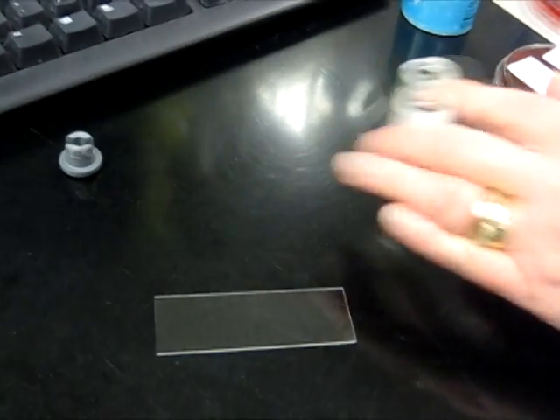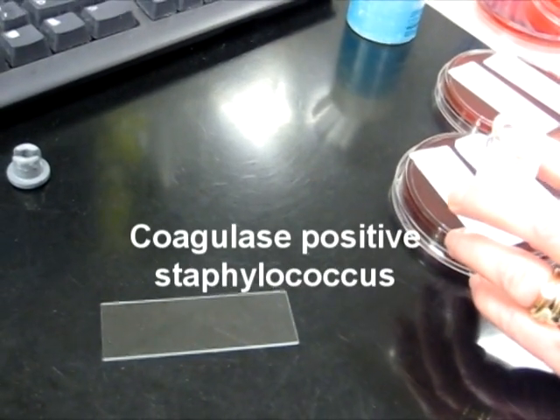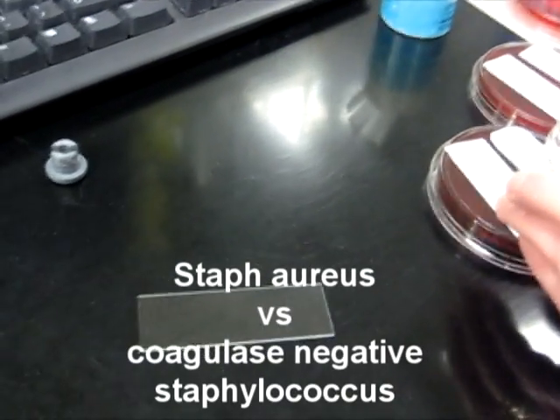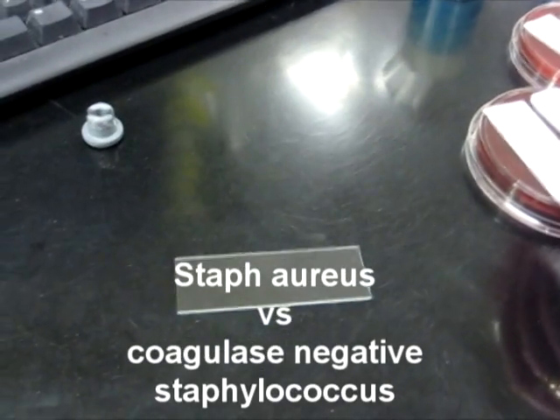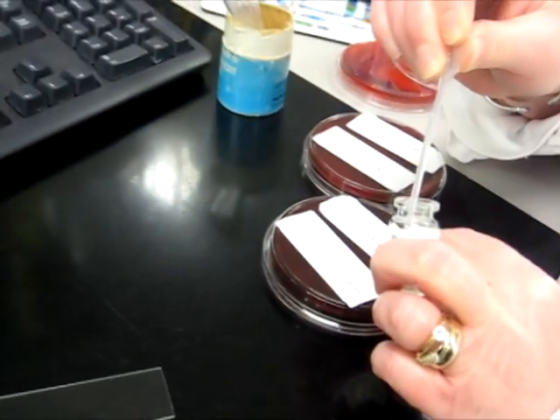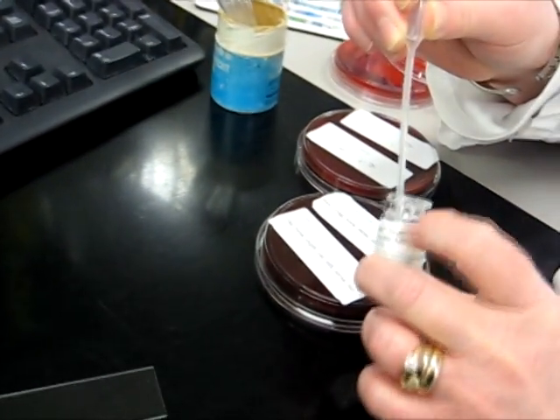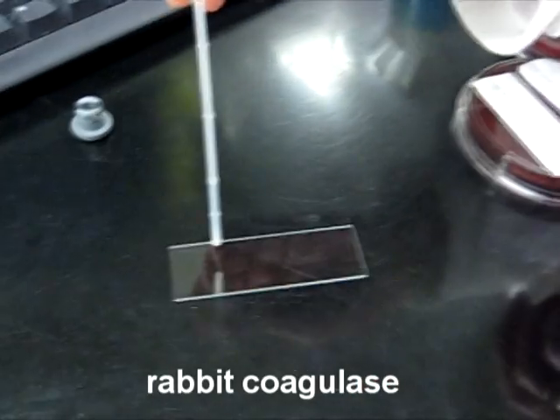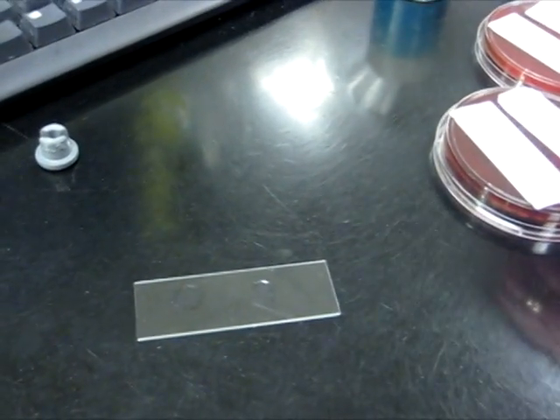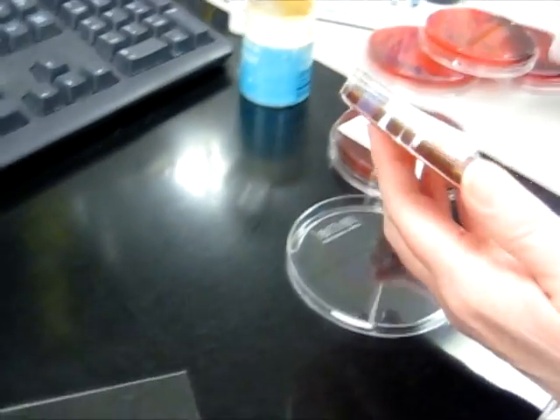The coagulase test differentiates between coagulase positive staph, also called staph aureus, and coagulase negative staph, also known as staph epidermidis. You use a drop of rabbit coagulase plasma and touch the center of the colony.